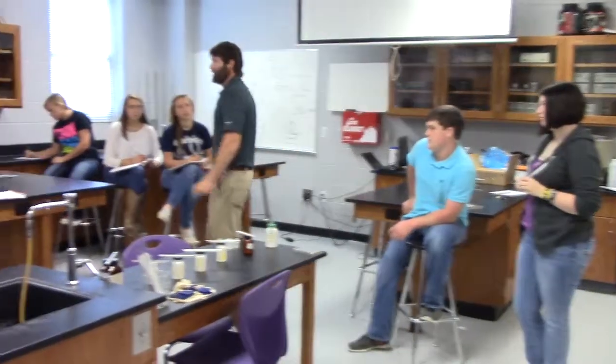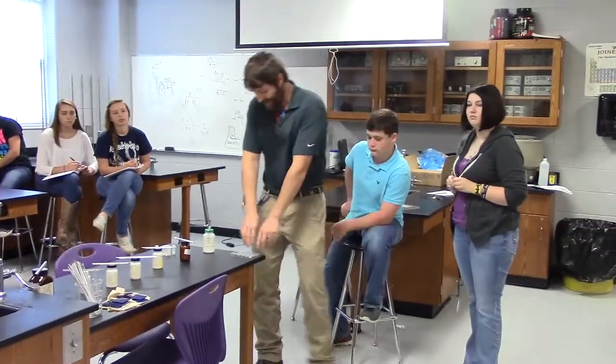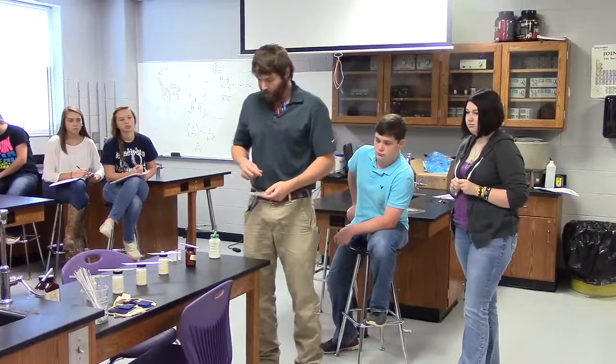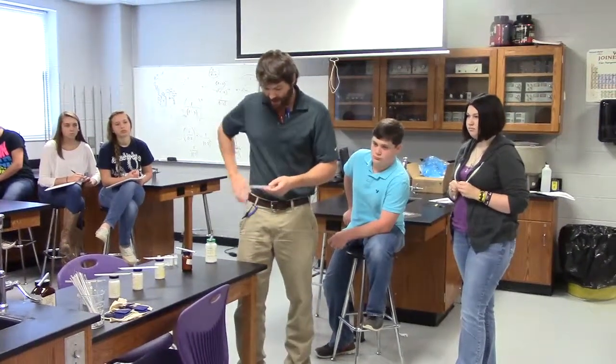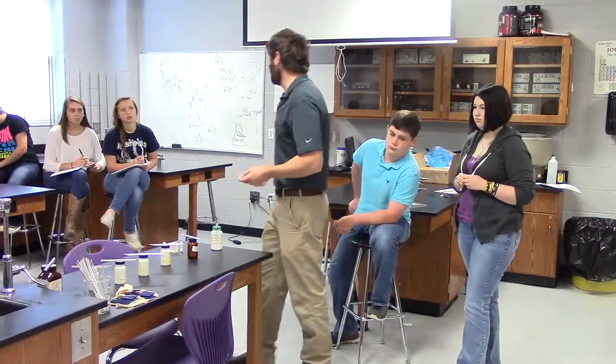Why? As soon as it leaves the container, guess what we consider has happened? It's contaminated. We do not take that because you dump it in this plate, and guess what? You get ready to put it back and you're like, I can't remember if that was the potassium or strontium. I'll just put it back in the strontium. And it turns out you had potassium the whole time. I've actually had somebody do this before.